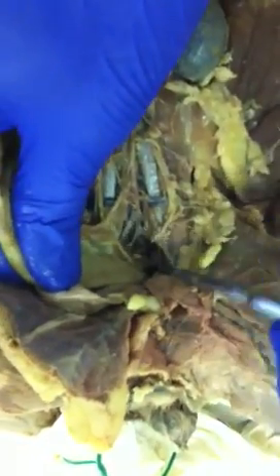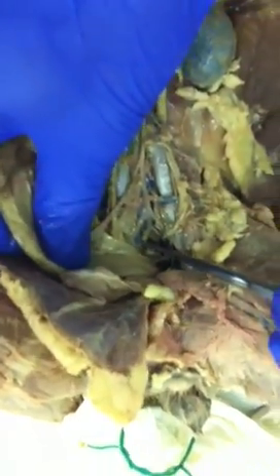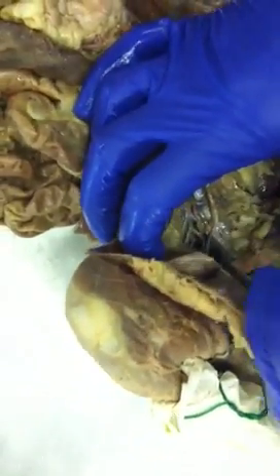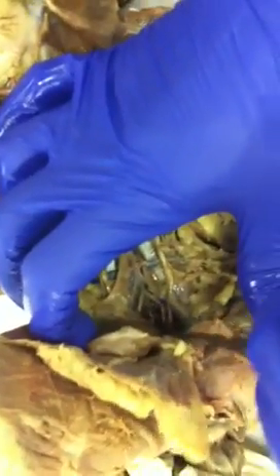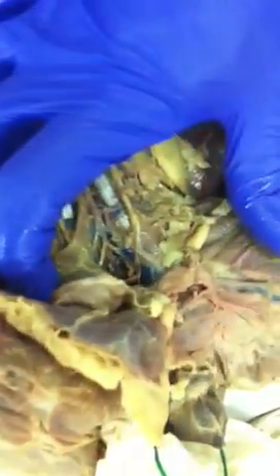Kind of the same names, but a little different setup on the veins. So you have external iliac, where it splits from the vena cava, and the internal is going to be a smaller branch off, a little dark, right down here. So it branches off of the external into the internal, pointing down. And then following all the way in the middle, this is going towards the tail. These are the caudal artery and vein under here. And that is it.